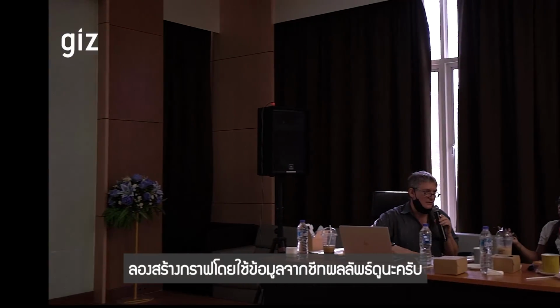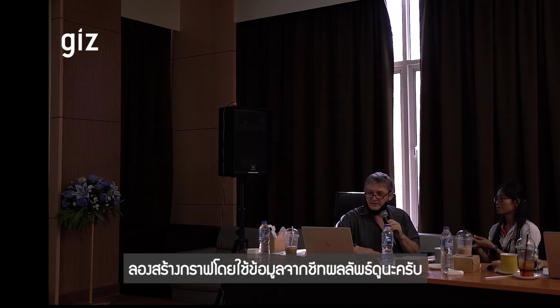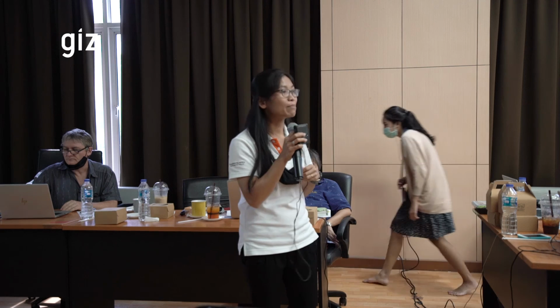Yeah. Okay. So please populate the graph sheet with the results data and then wrap things up. Yeah. Thank you.